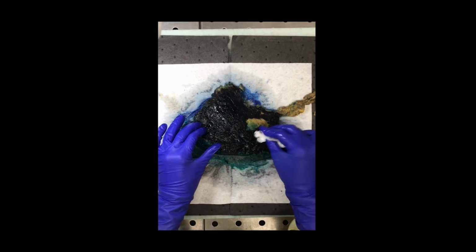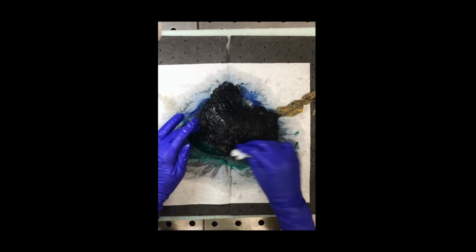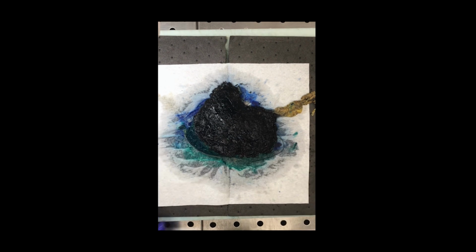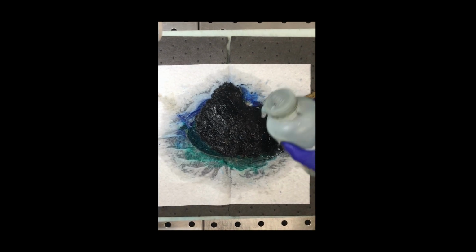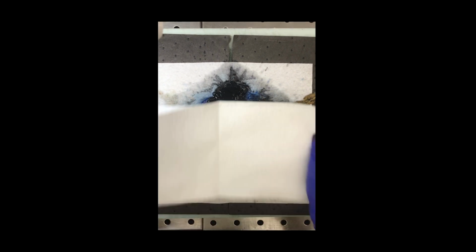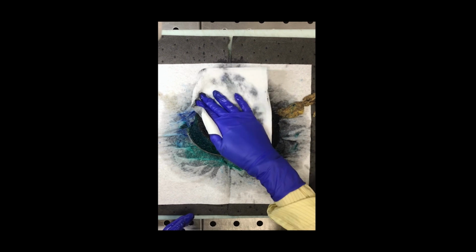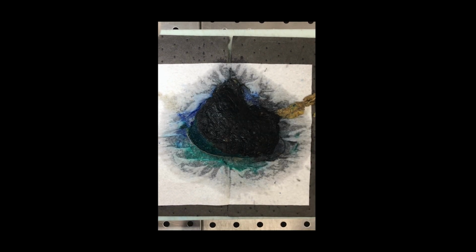So now I'm just finishing up with the inking part, and you can see that every aspect of that breast tissue is covered in ink. I don't have any exposed breast tissue. And I'm going to spray it down with acetic acid, and that just helps to let the ink really stick onto the tissue. And now I'm patting it dry. And I want to make sure that the specimen is really dry before I make any cuts. If I try cutting it when the ink is still wet, that ink's going to actually run right into the breast tissue.